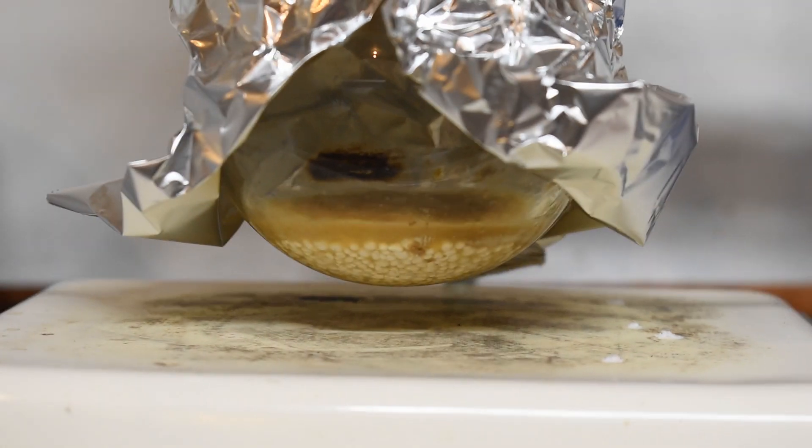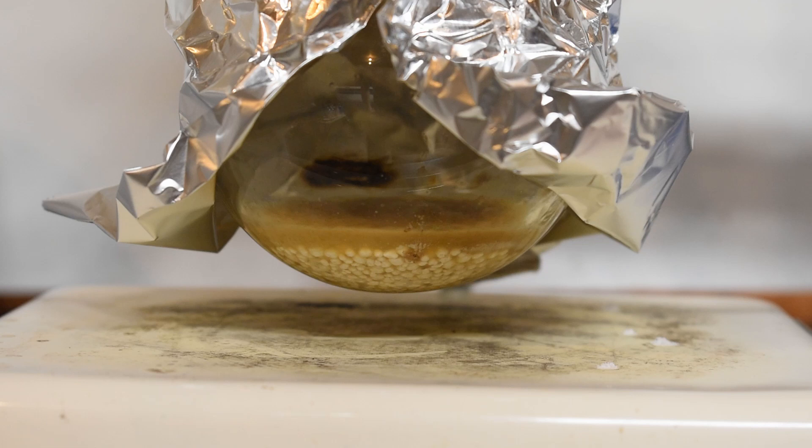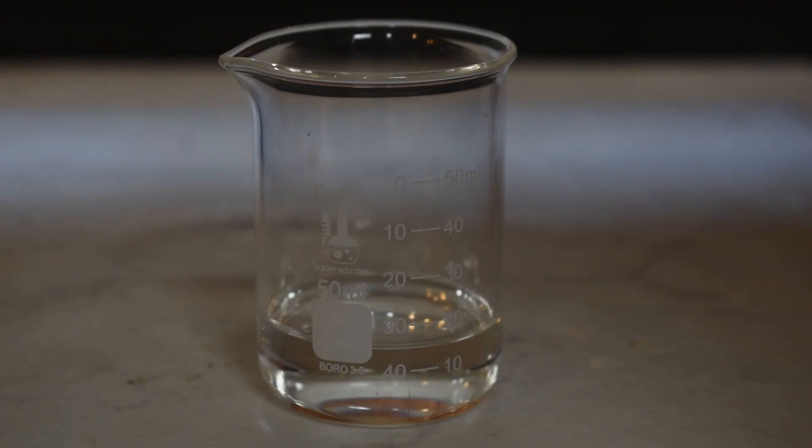There was also a really small amount of water trapped in my condenser after the distillation was complete. So from what I can tell my thermocouples are just wildly inaccurate. But despite this, we were getting some really nice crystal clear liquid coming over, and although this might not be 100% pure isoamyl acetate, I'm just going to tell myself that this is all good and buy more thermocouples from Amazon later.